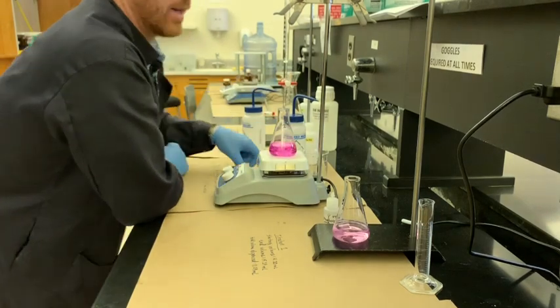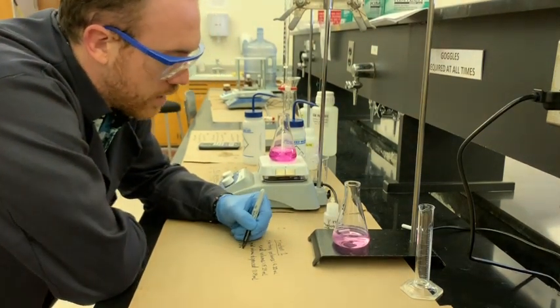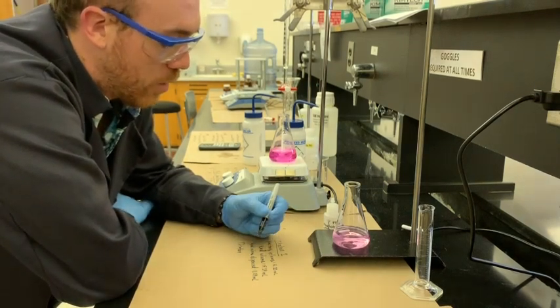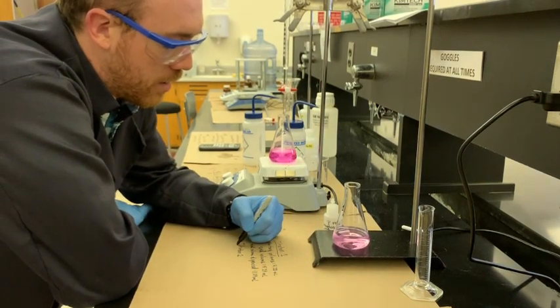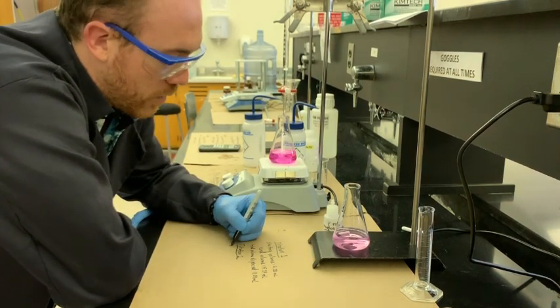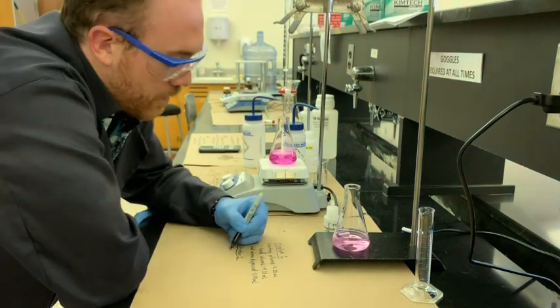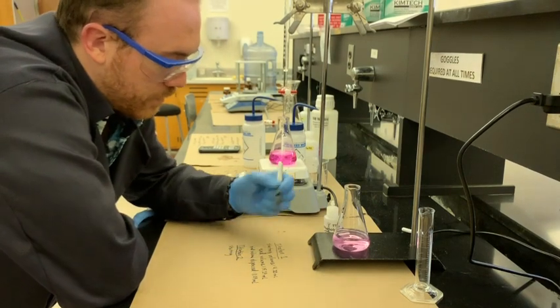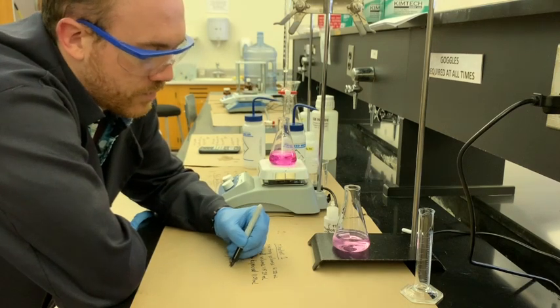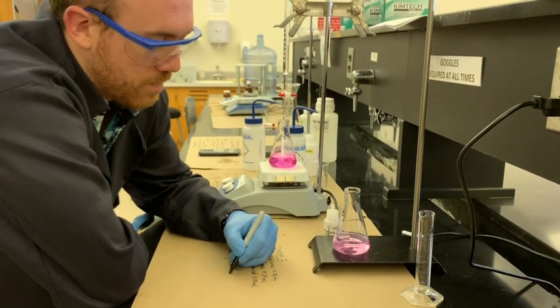Now, when we look at the start volume for titration 2, we didn't take any actual base out of the burette from titration 1 to titration 2. So the starting volume for titration 2 will be the same as the end volume for titration 1. Usually you probably should record it beforehand, as a matter of principle. So it's going to be 15.29 milliliters.